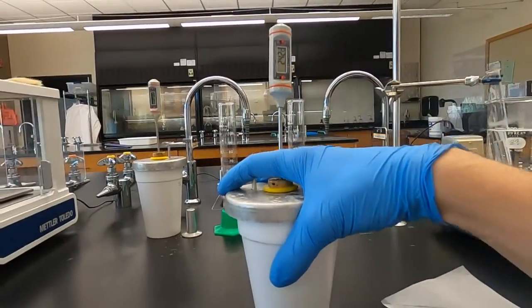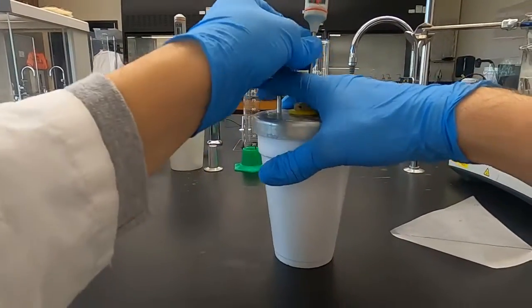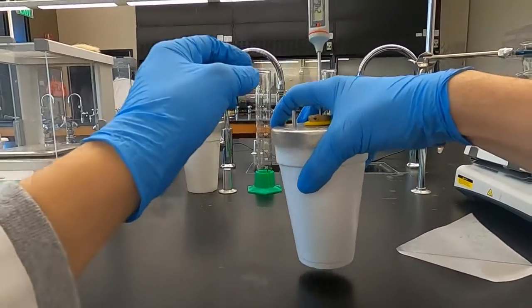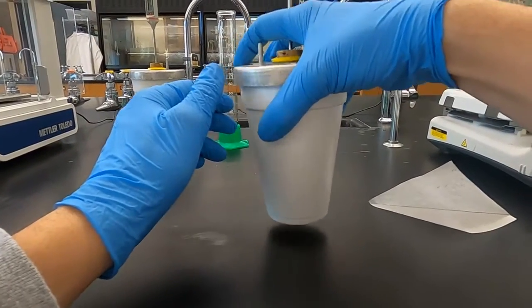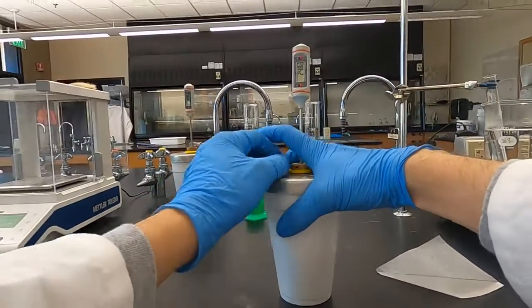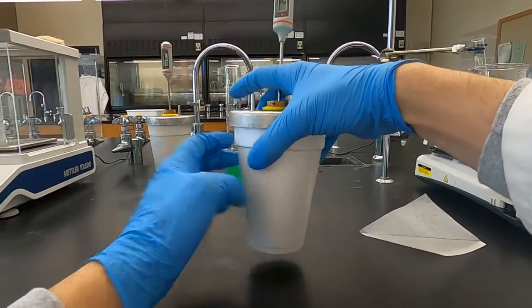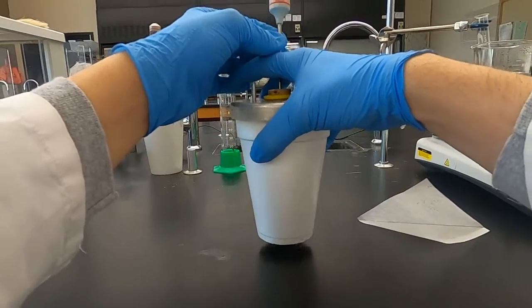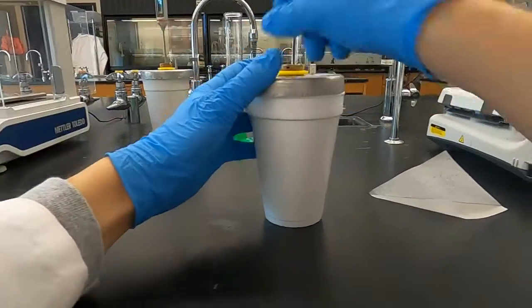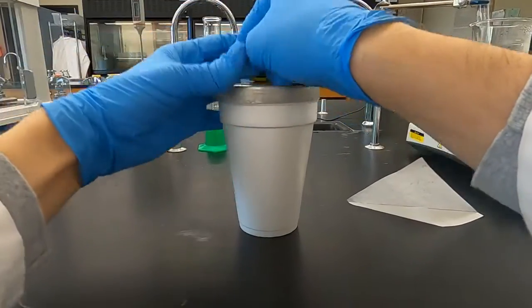Bottom of the cup doesn't feel too hot. If you took Chem 5, and you saw a previous calorimeter, and you saw a change in some of the samples we use there, a few went up into the 40s, and you could really feel the heat on the bottom of the cup. This one, not so much, but we are on the rise. We're at 24.9 so far. Nice little mix in there. See what changes. 25 now.